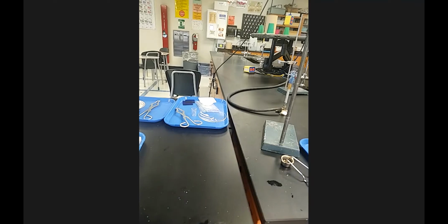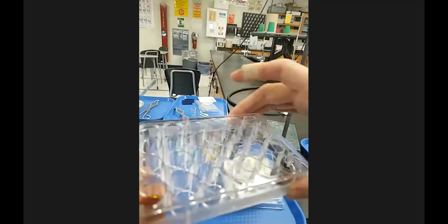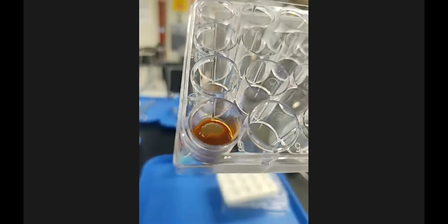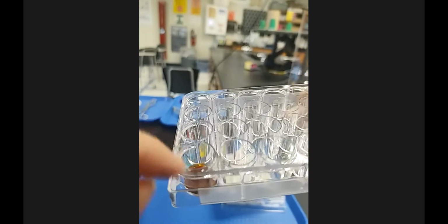Grab 5 here, bring it back over. So this would be the later for 5. And let's look at this one. So still the residue from the side. We've got more distinct layering. Looks like the red, orangey brown is further down, and there's more of a yellow layer on top. That was again the copper 2 chloride potassium chromate. This is the silver nitrate potassium chromate.